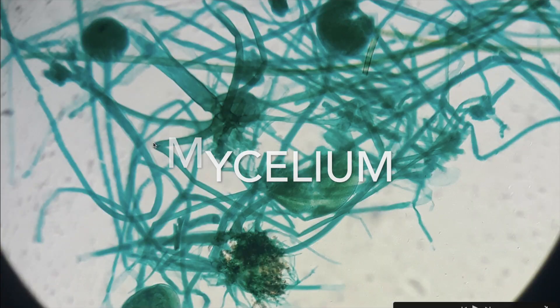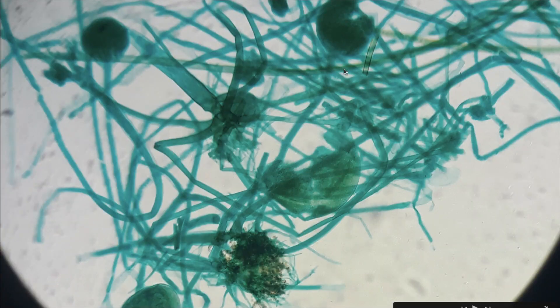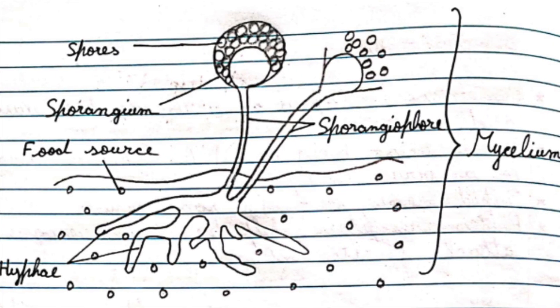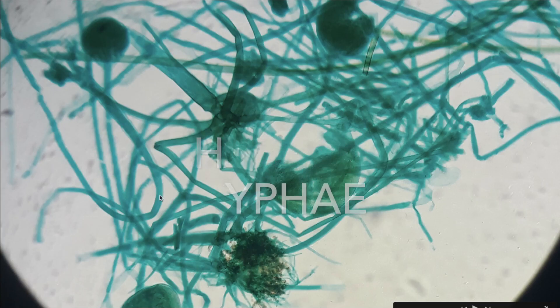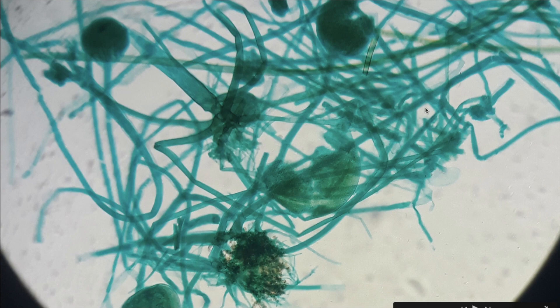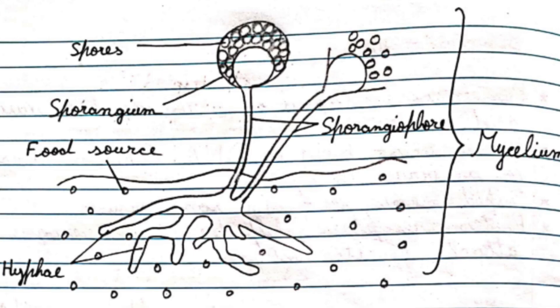This is the mycelium, which is the entire network of the fungi. The hyphae are long filamentous branches — these thread-like structures are used for support and feeding.